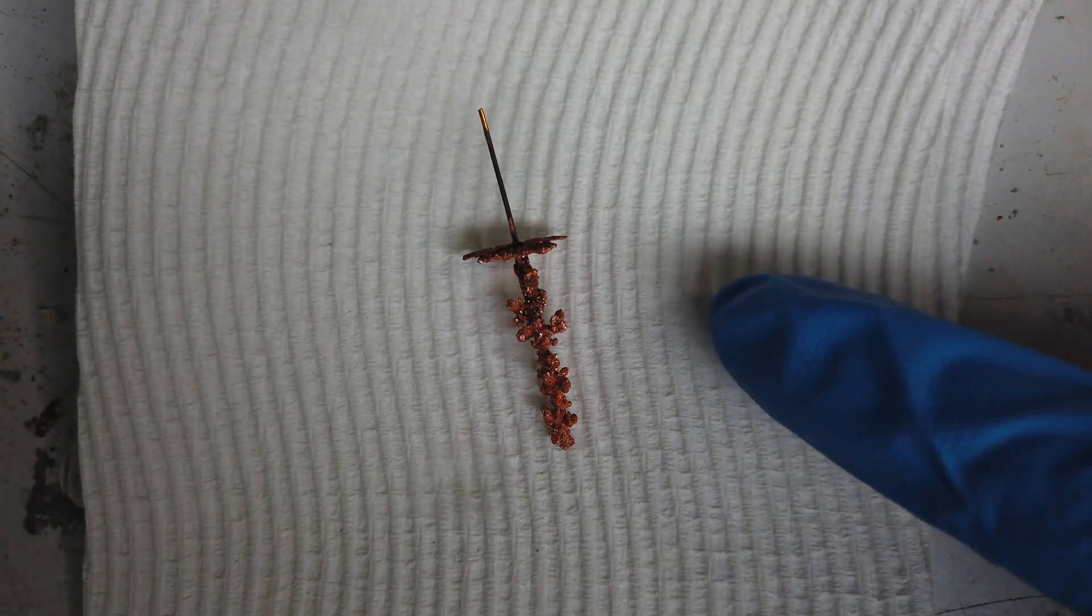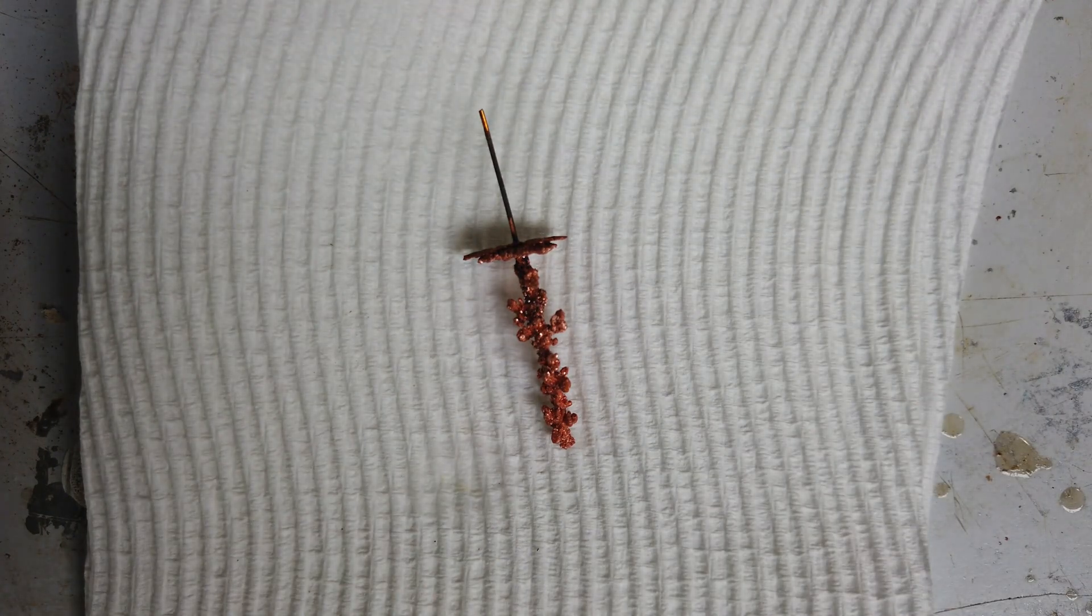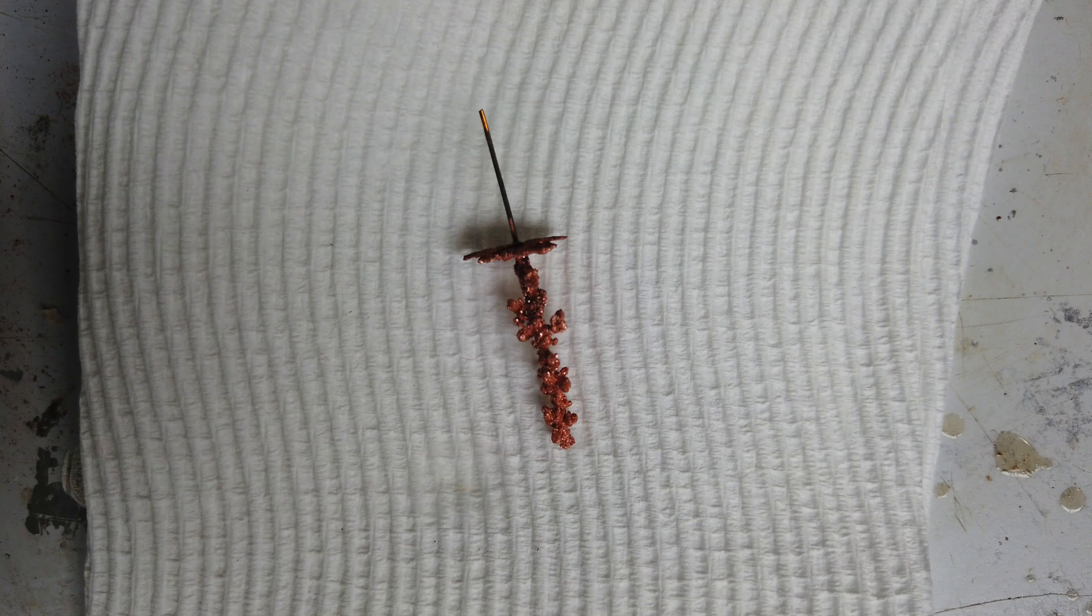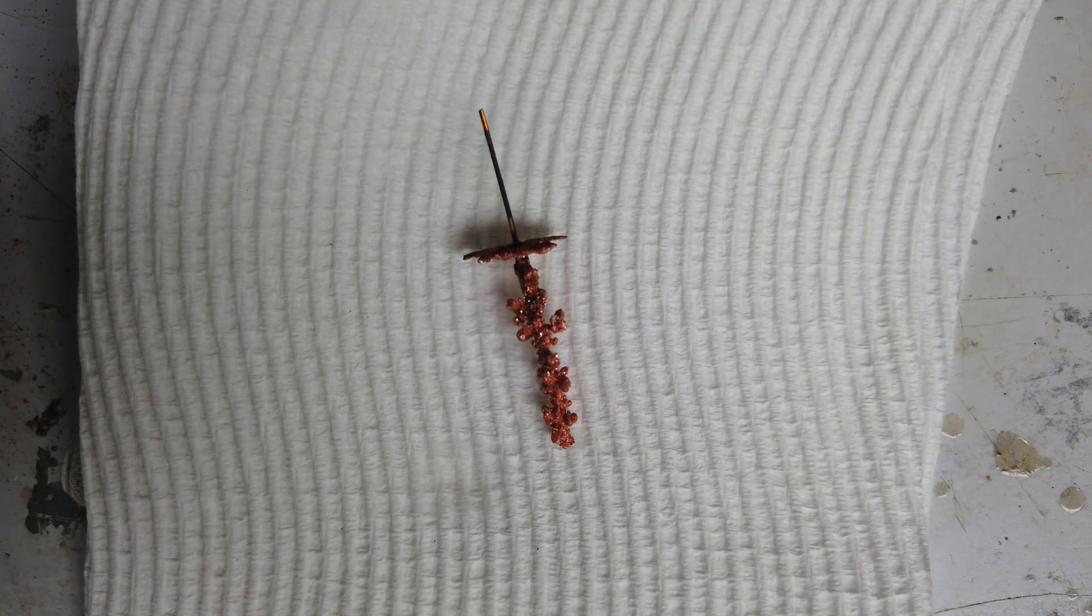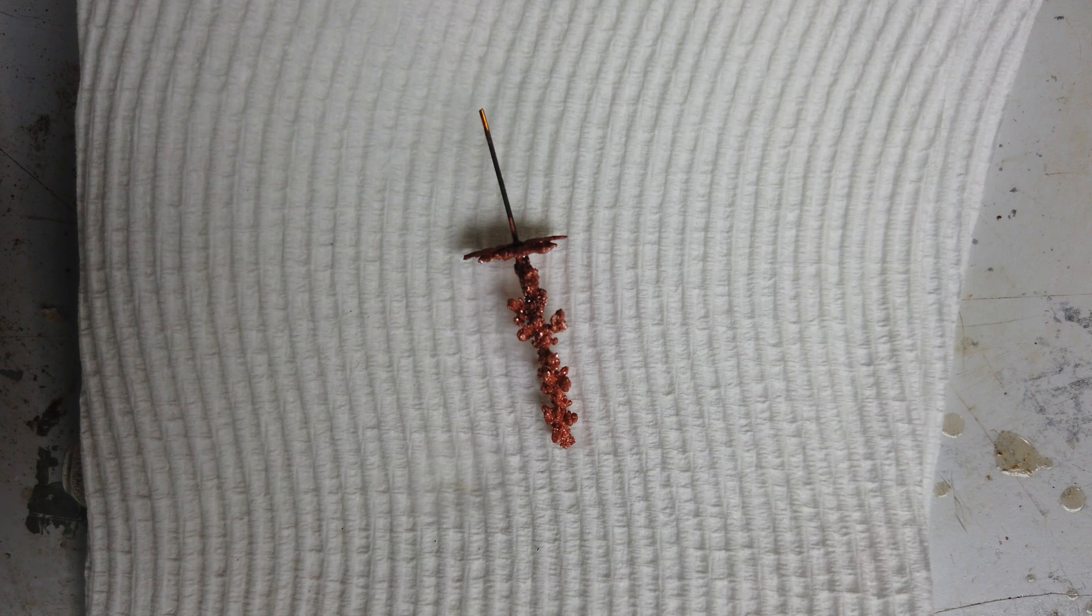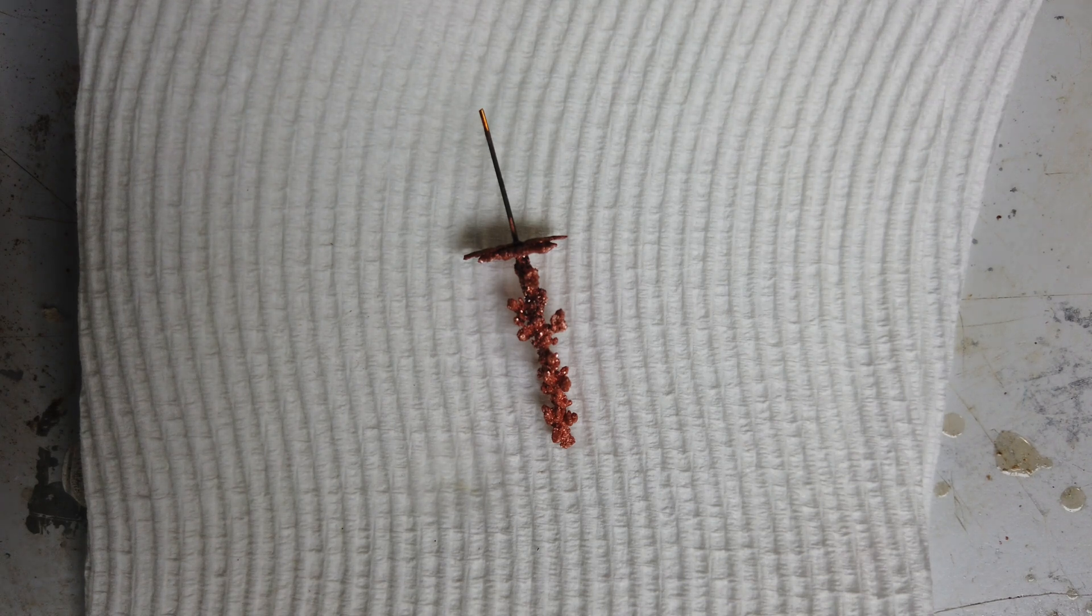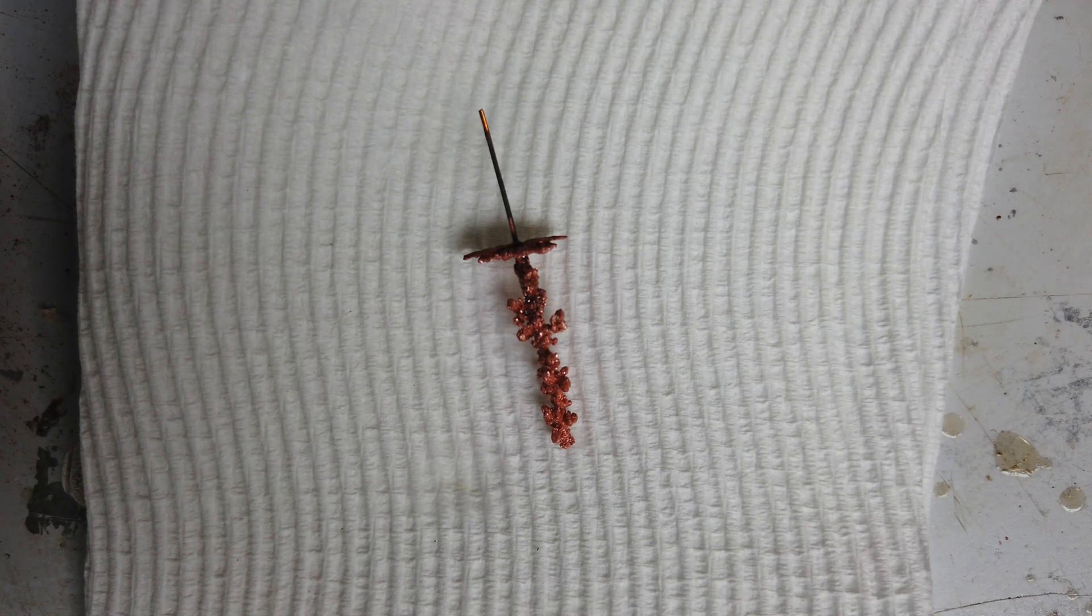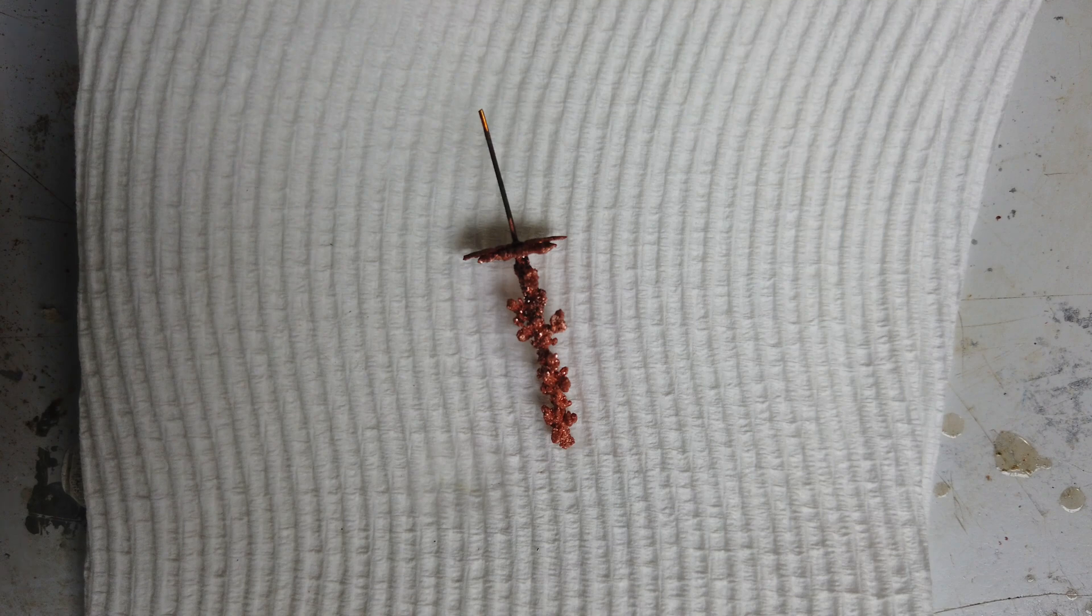To be honest, a little bit underwhelming for two months of work. I was expecting the copper crystals to be a little bit bigger, as in the facets would be visible macroscopically. Instead we do have somewhat crystalline copper it looks like, but the crystals are very small and it's not quite as striking as I was expecting.